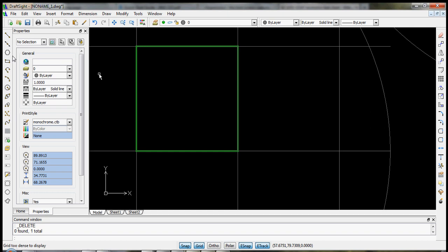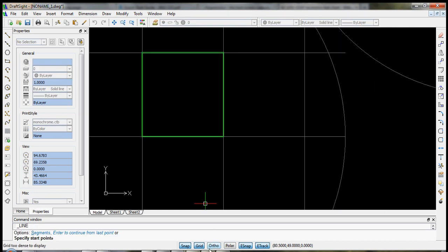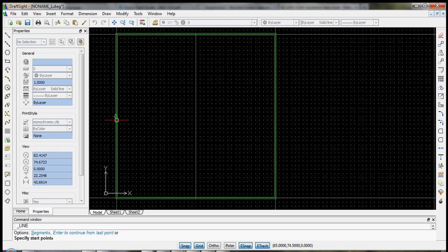Now within this square we can begin to construct our microfluidic pattern. So the first thing I'd like to do is make some more construction lines. So let's actually make one in the center of the device, from the top to the bottom. And we'll do the same in the horizontal dimension. Again, I'm looking for these triangles that signify the midpoint.